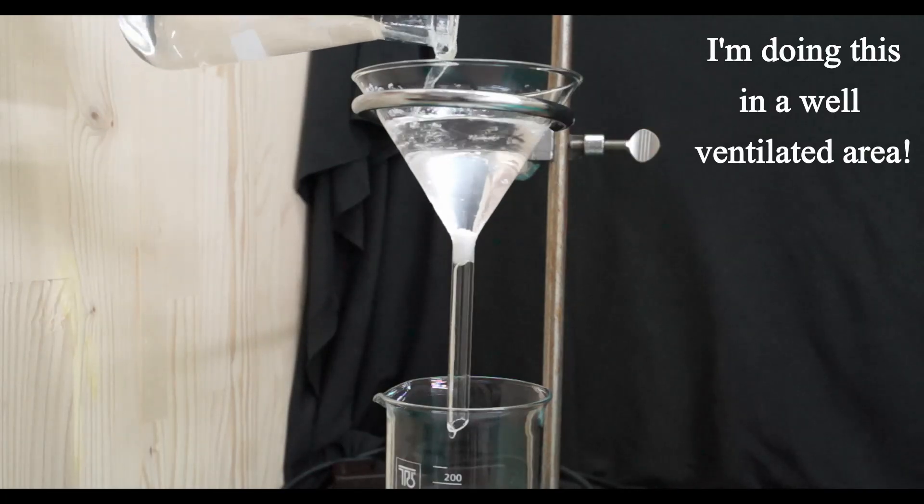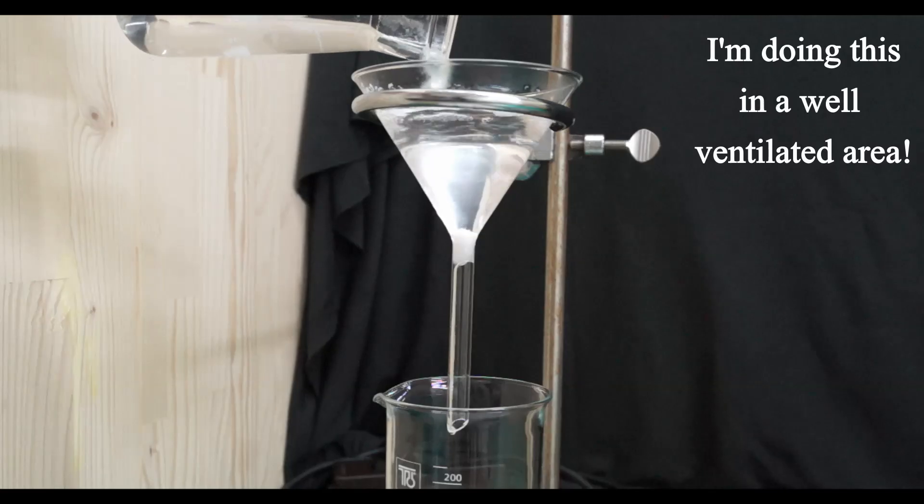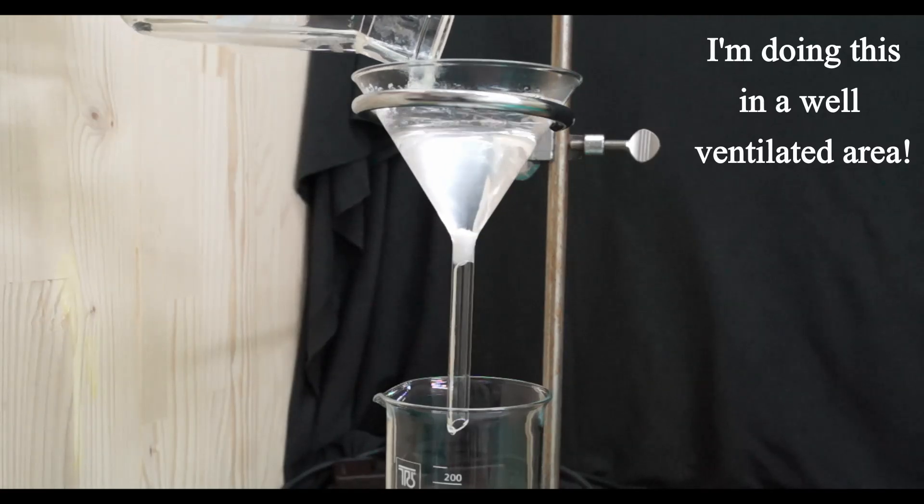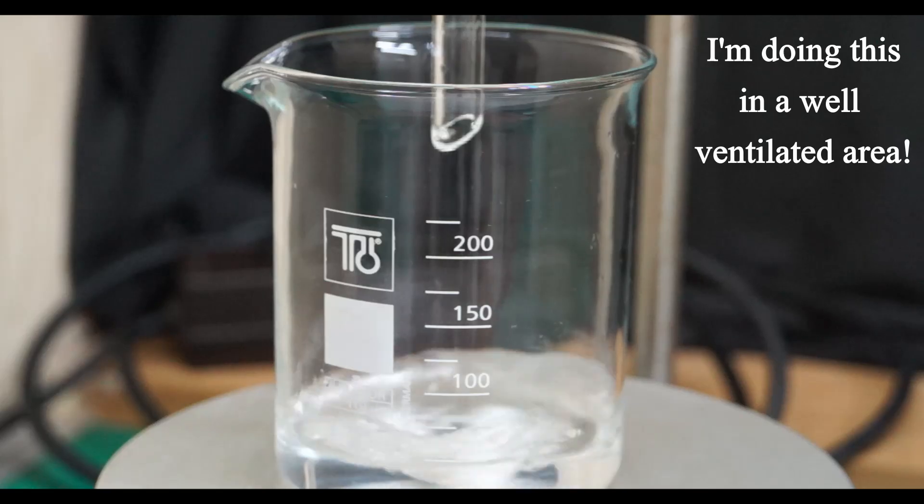Even after re-dissolving the product by heating the vacuum flask with a heat gun the filtrate was still slightly cloudy. It would seem that a very small amount of excipients got past the filter paper as I was doing the vacuum filtration.